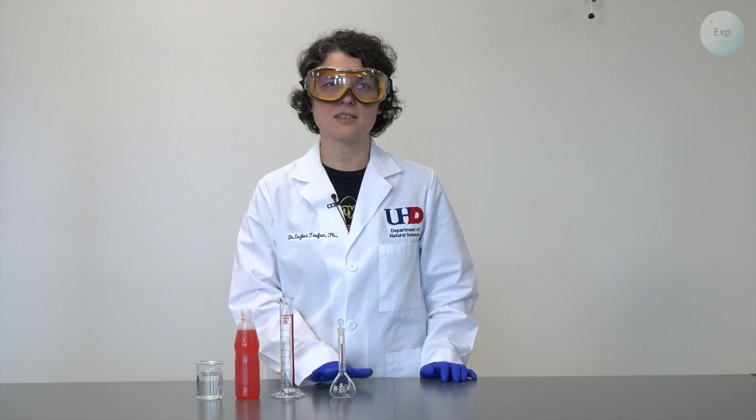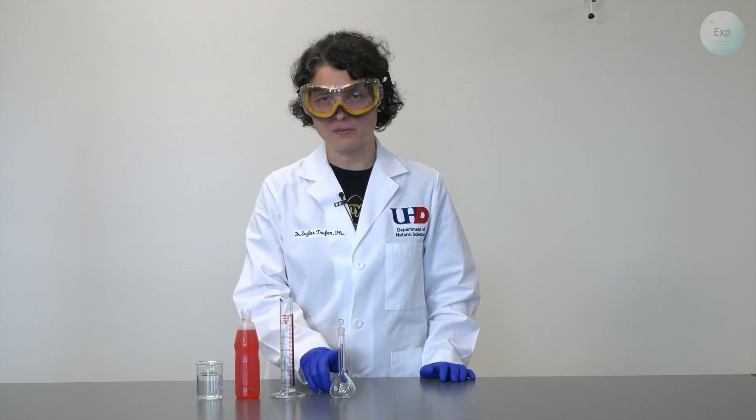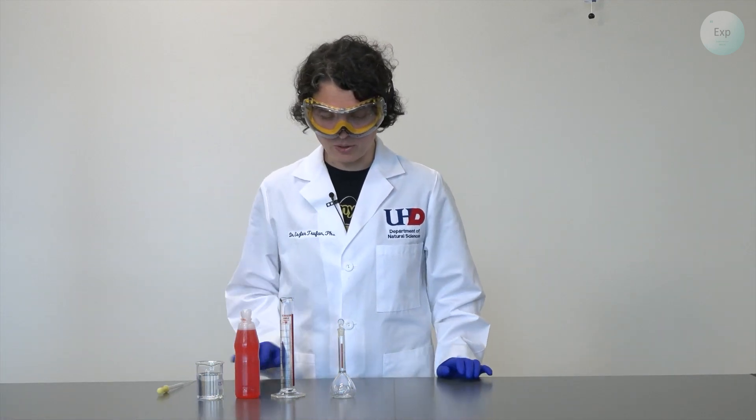And finally because we are making a solution and it is important that we do not exceed the marking on the volumetric flask I will be using a pipette with a bulb.